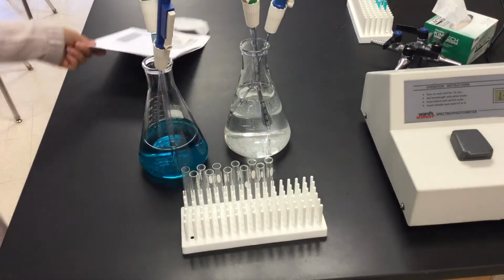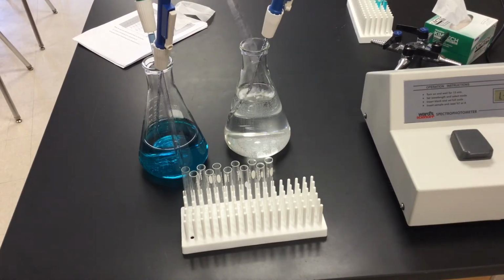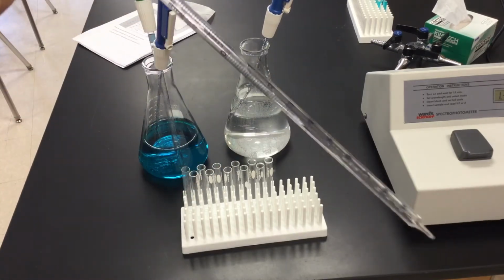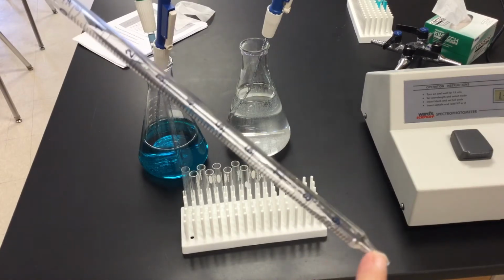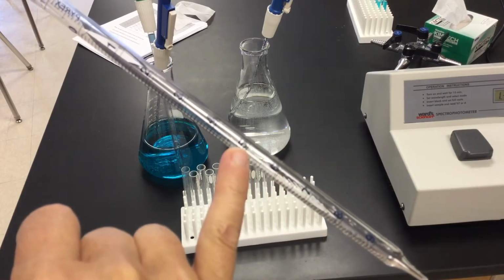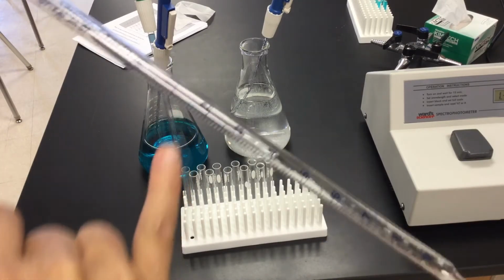So last week we did micropipetting, where we looked at teeny tiny little amounts. These particular pumps that you guys see in front of you here are known as pie pumps. And these pie pumps are kind of like graduated cylinders, meaning they can measure up to 10 mLs. So if we're starting at the bottom here, it actually will count backwards for you, because as you're filling them up, there's 1, 2, 3, 4, 5, 6, 7, 8, 9, 10 mLs. And you can also do your half mLs on here as well.